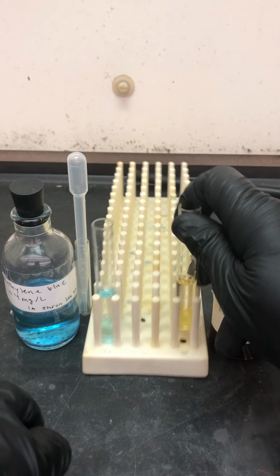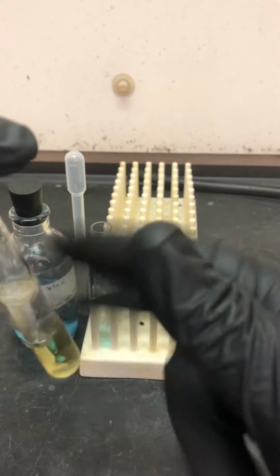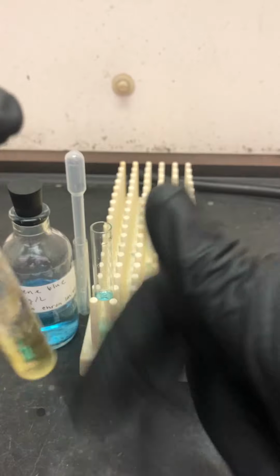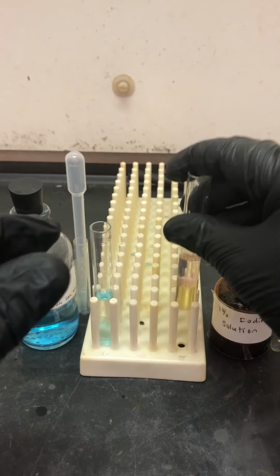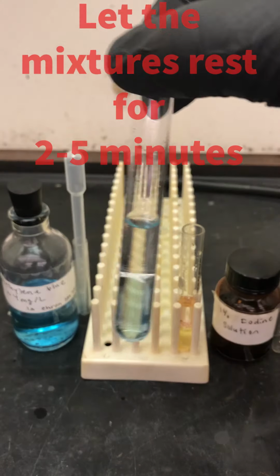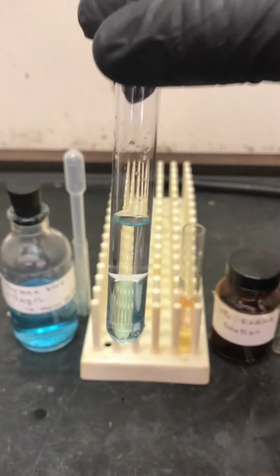And let it rest a little bit. Now let's do the same thing with the iodine one. Let's see what happens. Let it rest. And what we can see is, as of now, the methylene blue is staying in the bottom and the kerosene on the top with no visible changes.